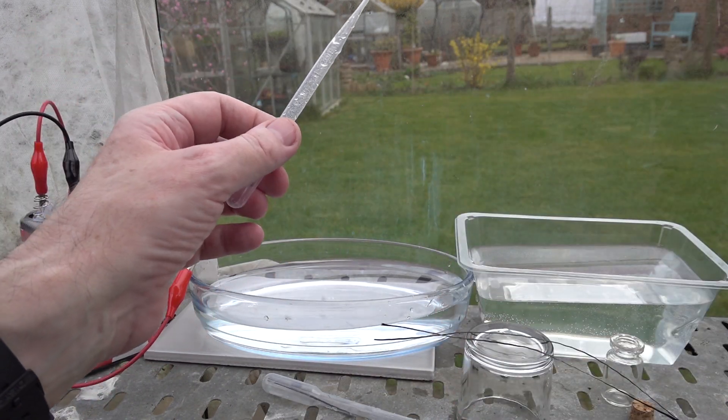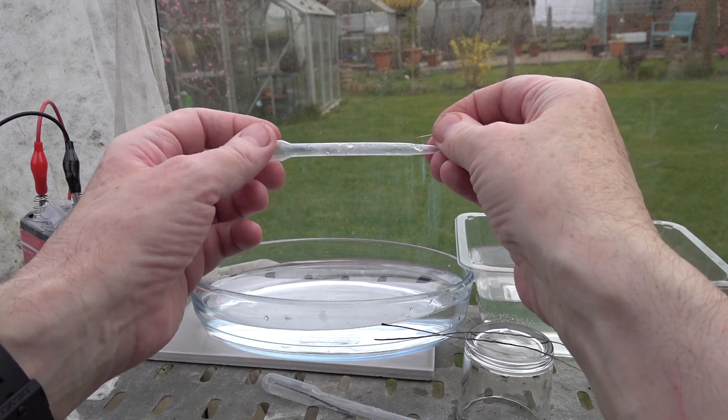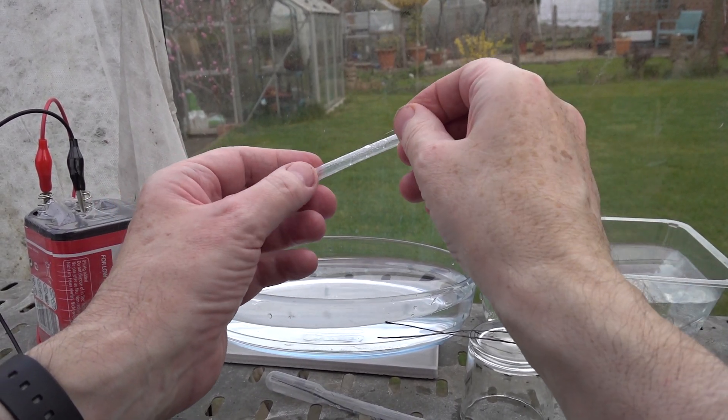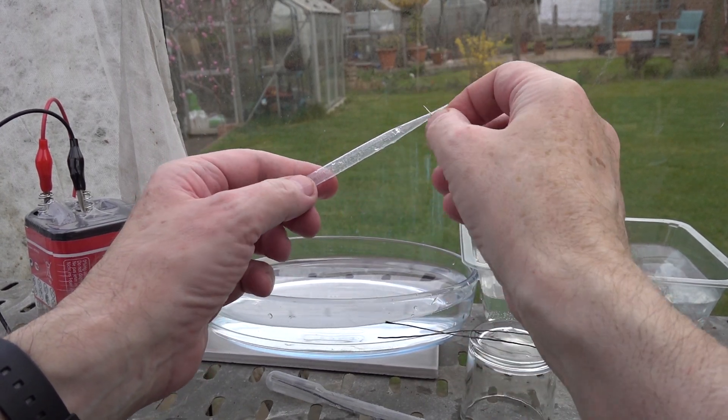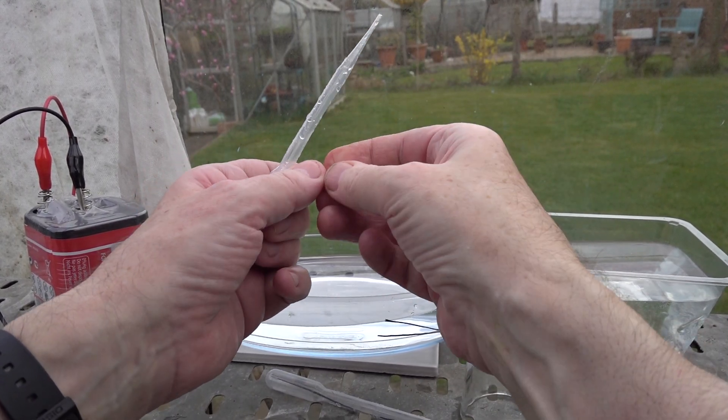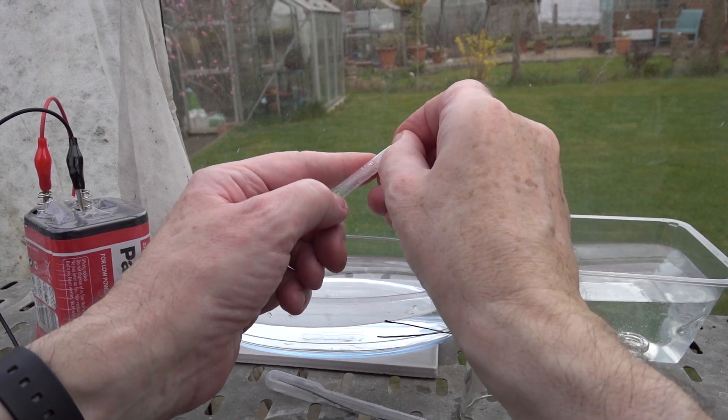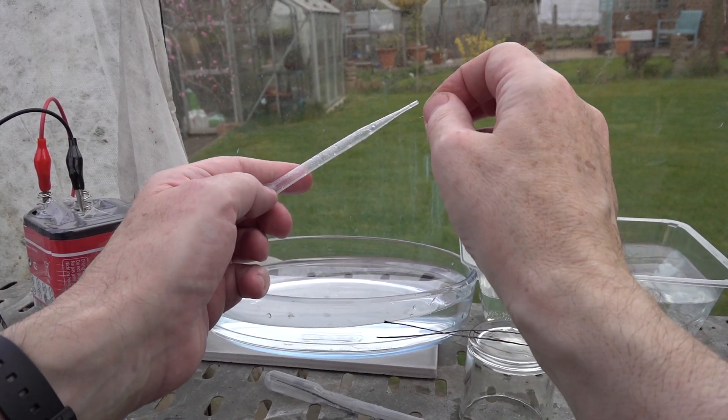There's one further elaboration: you need to take a pin or some sharp object and between the half and three mil graduations on one side of the wall of the pipette, make lots of tiny little holes. I made about two or three hundred in this one.